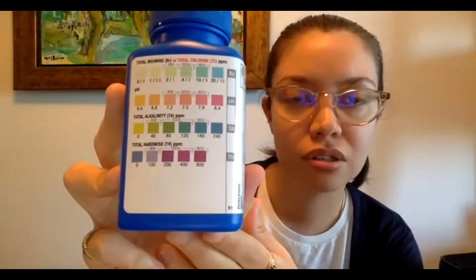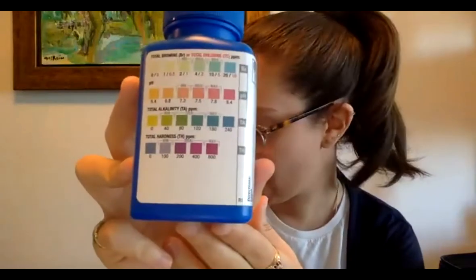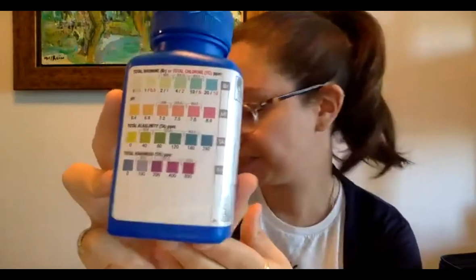The alkalinity and hardness are related to each other and also related to conductivity. So it's about the different salts that are dissolved in there, and the calcium and the magnesium. I don't know the ranges by heart, but if you ever have any questions about what the normal ranges are, all that information is in your field guide. So while you're out there, if you get a reading and you're unsure, just go look in your field guide.